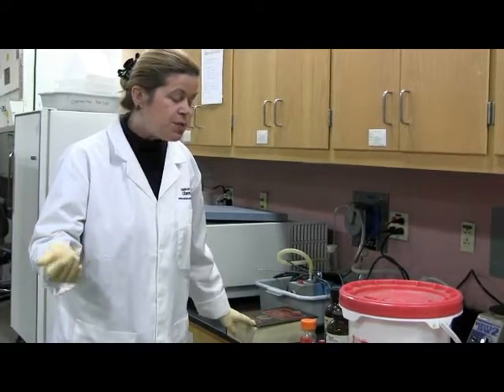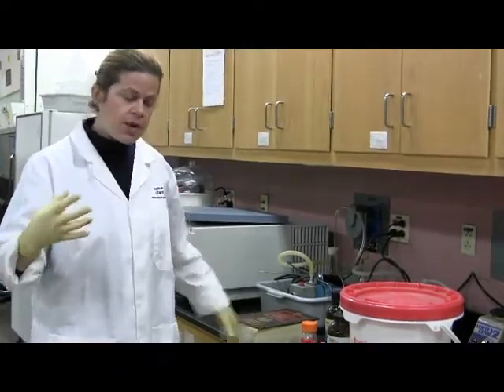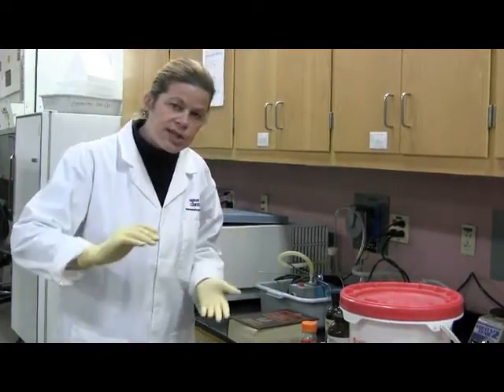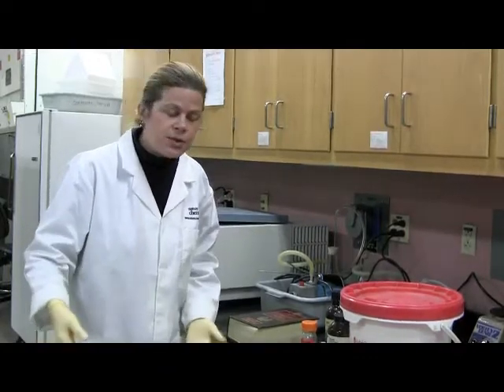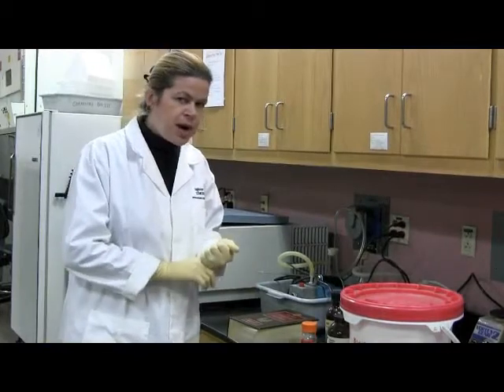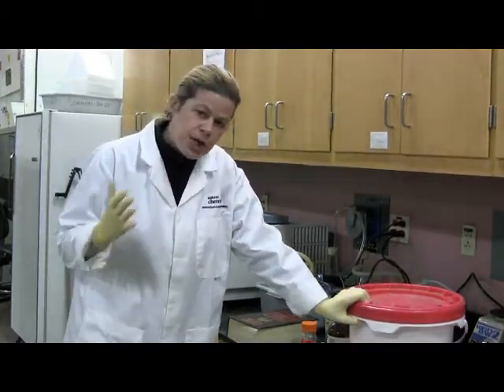And the idea is, as you may recall, that enzymes have different activity at different pH. Remember how the protonation, depending on the pH, changes, and that makes the enzyme more or less active at different pH values. So, according to the procedure, you're going to prepare tris buffer, okay, at different pH values.